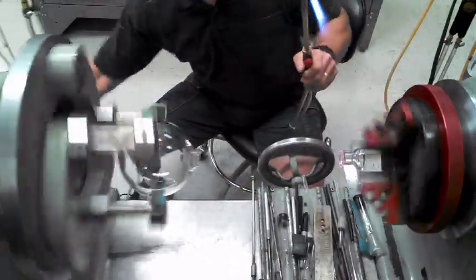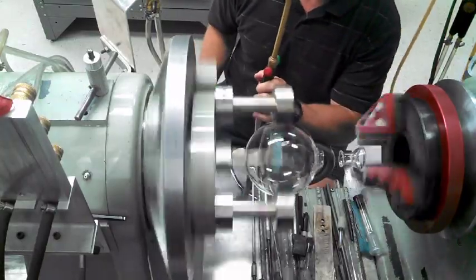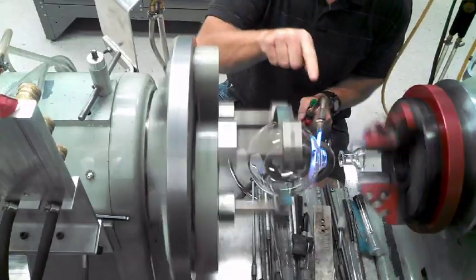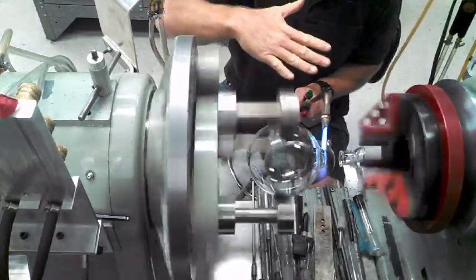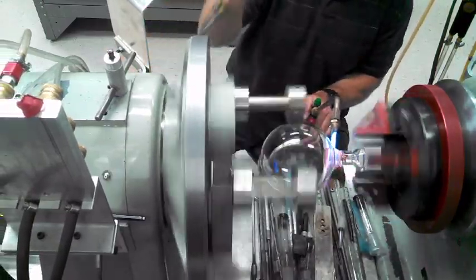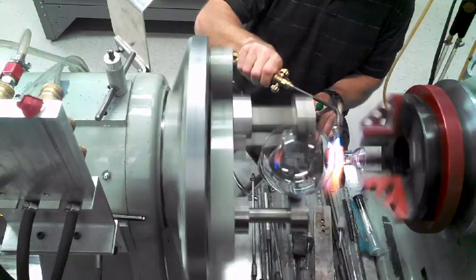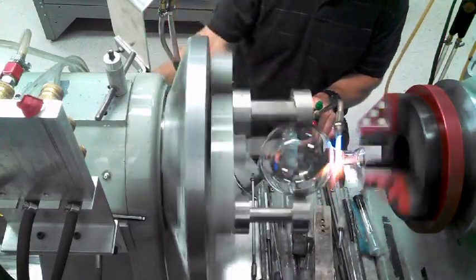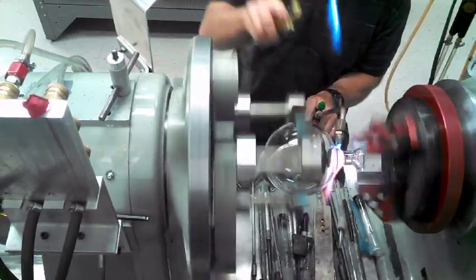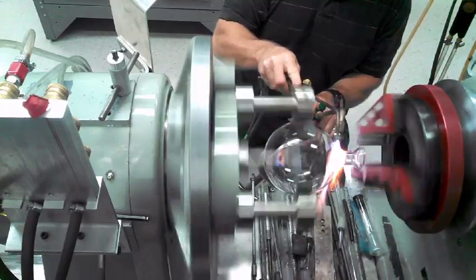So this is a no-blow tool seal. Once I attach it, I'm going to keep my flame mostly focused on the shoulder. So when it melts, it's going to come up. It has a little more power. Like so — open the flame right here, back side bit, put it in a fork.